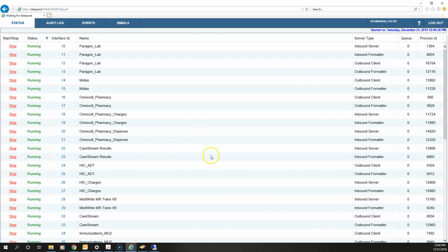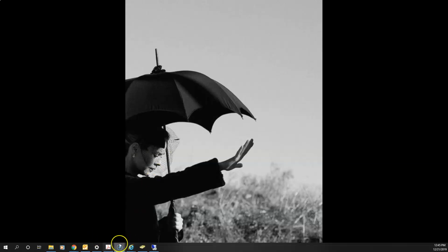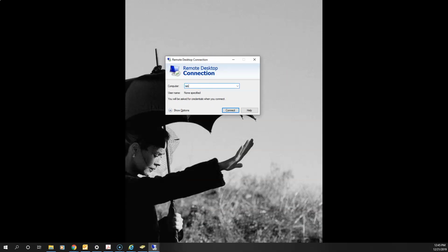Okay. Now there's one additional step for the results to post into Paragon. So this goes into N tier, and then N tier has to use LabProc, the lab processor, to go ahead and post into Paragon. So we're going to open another RDP session. We're going to remote to lab proc p. Now I already have these credentials saved on my computer, but it's very, very important that you remote to lab proc with the lab proc credentials. If you don't do this and you log in with your own, you're going to ruin everything and you'll have to restart the server anyway. So log in with the lab proc credentials to see what's going on.